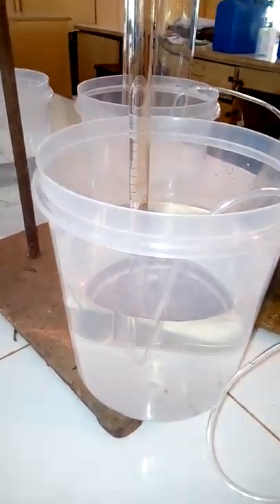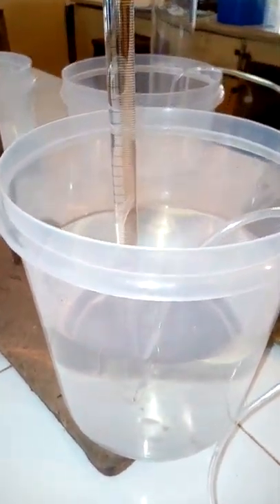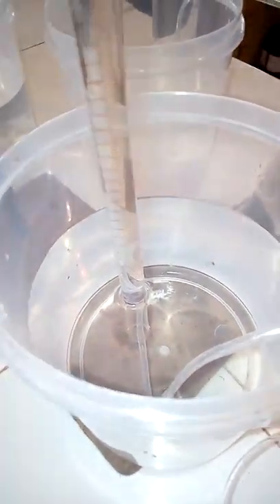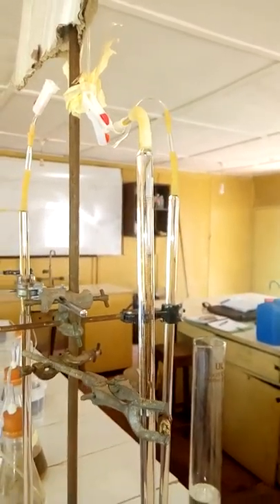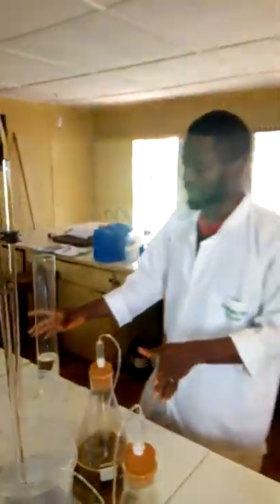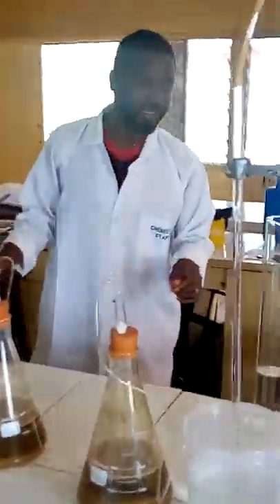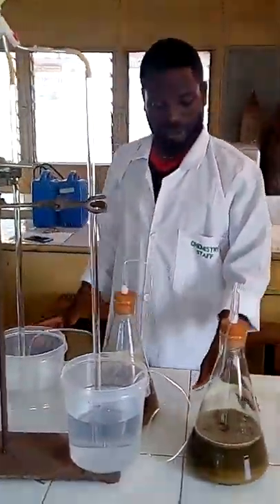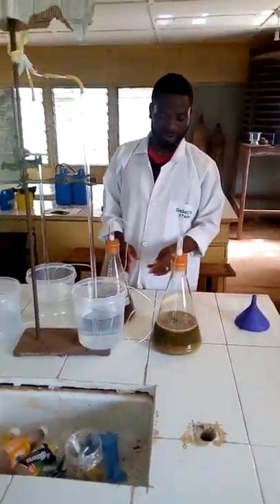We decided to use rumen fluid and intestinal cow dung. In this setup we have three stands, each with three conical flasks, for a total of nine conical flasks. There are some variables that are constant and some that vary across the stands.